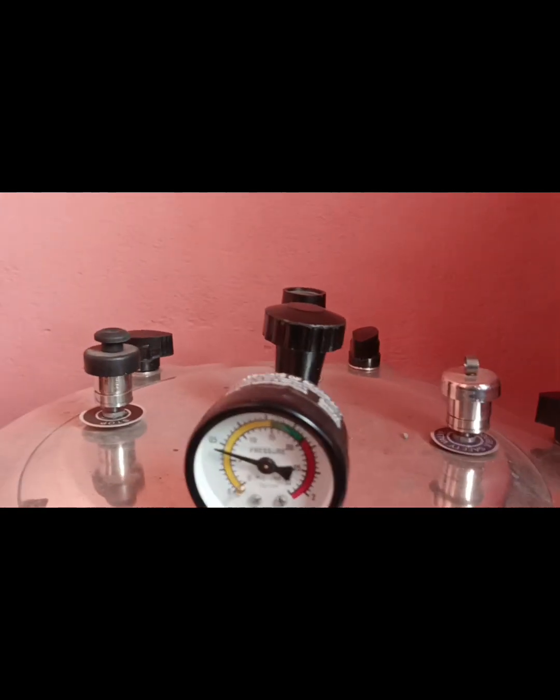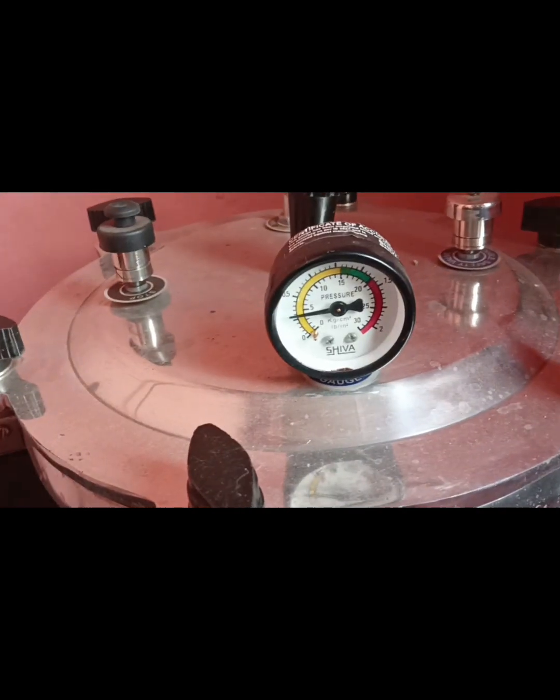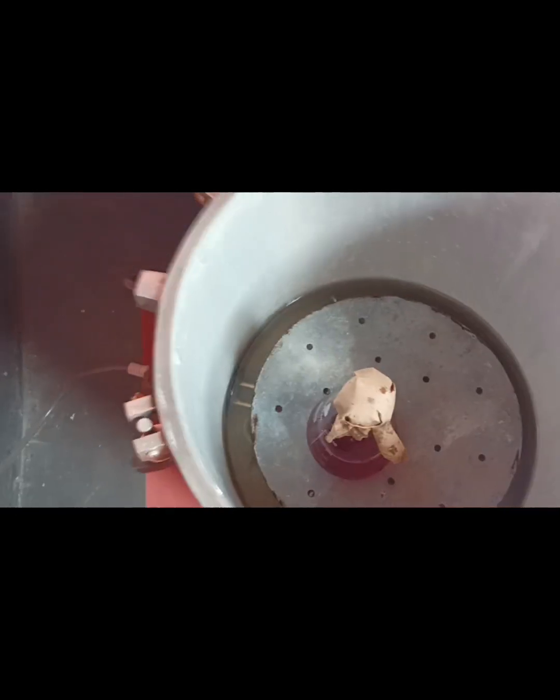Release and switch off the autoclave. After that, we will open the autoclave lid. After the complete autoclave process, we open the autoclave lid. Now we can see the autoclave process is totally complete.